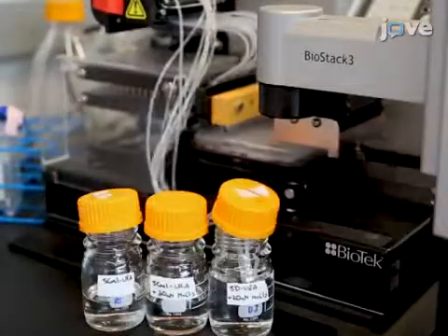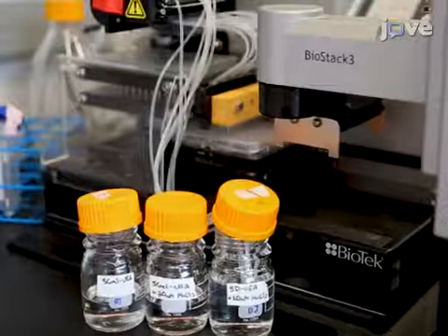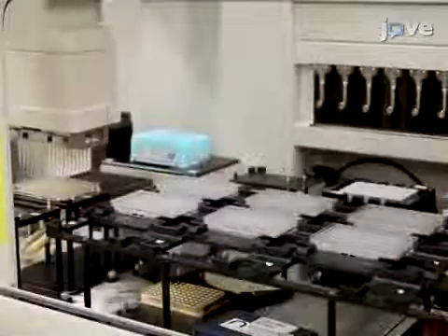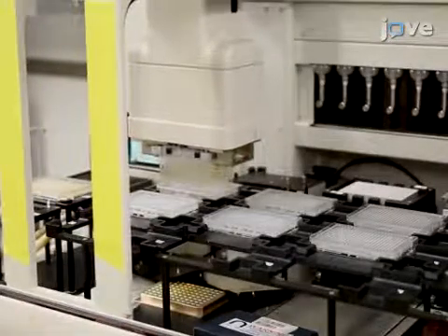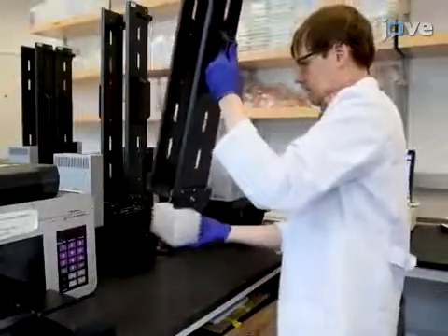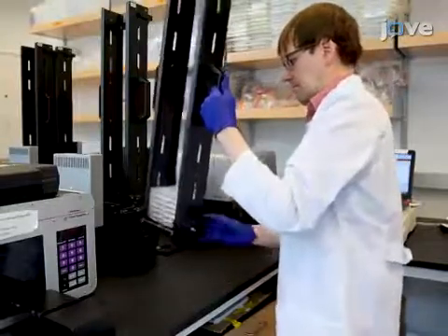Thirdly, dispense SD-Ura, which will not induce plasmid expression, plus manganese chloride into another plate. Load the 96-well plate containing the cultures onto the liquid handling robot and inoculate a 1 to 4 array of 1 microliter from each well of the 96-well plate into 4 separate wells of each 384-well plate filled with the different media. Immediately place the plates with cells on a microplate stacker at room temperature and atmospheric carbon dioxide.